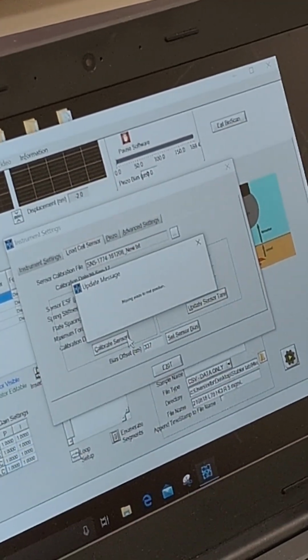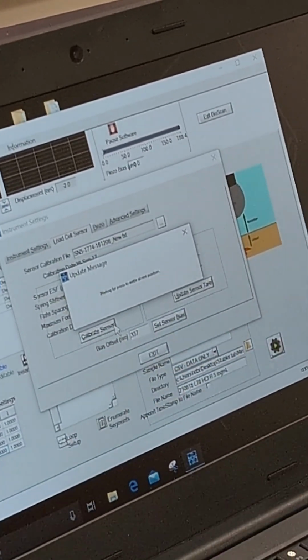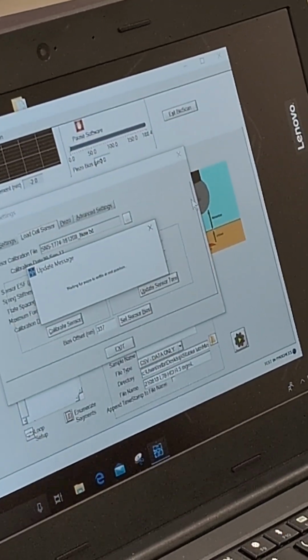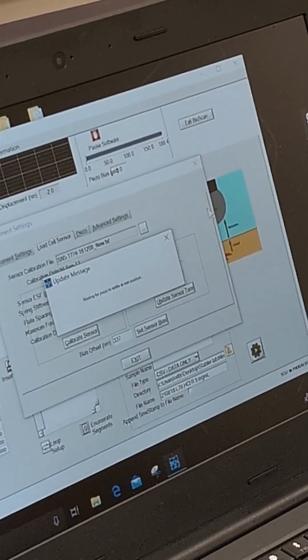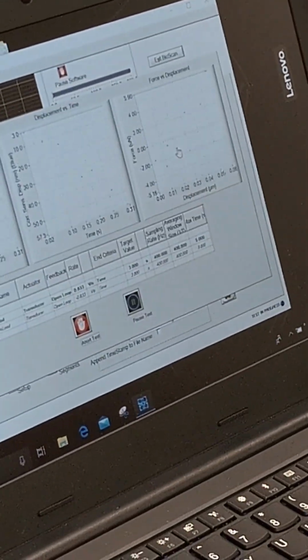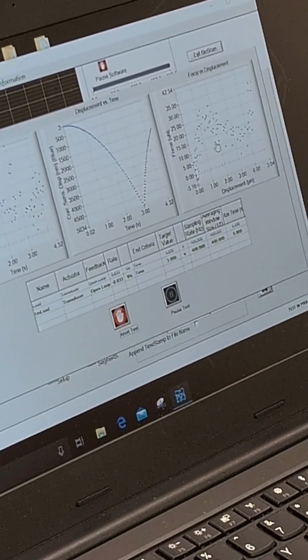How do you know when it's done taring? It will basically run, and then the mouse symbol will turn back to the cursor instead of the hourglass symbol, and you will be able to see the number changes.